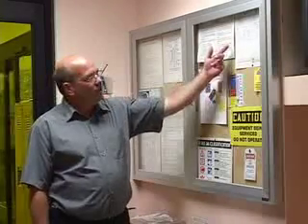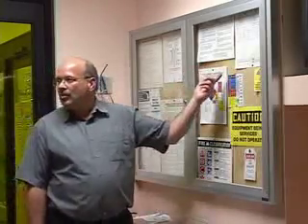They have E-guns, E-beam, that they're using for deposition, writing, or imaging, which would be an SEM or an E-beam lithography tool or a thin films E-beam evaporator. They're all listed here. They've all been certified by OSEH Radiation Safety as not having any levels of detection when they were last monitored. This is updated every 2 years. So we feel and know that our equipment is quite safe when it comes to exposing people to X-rays.